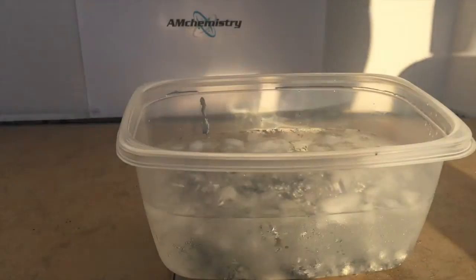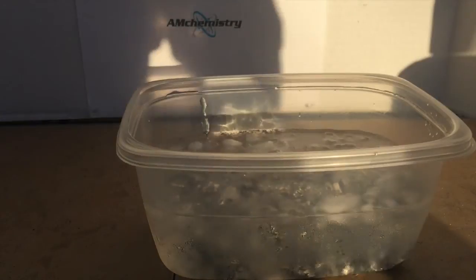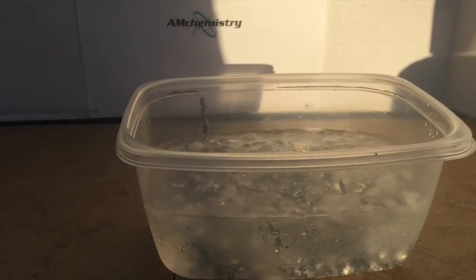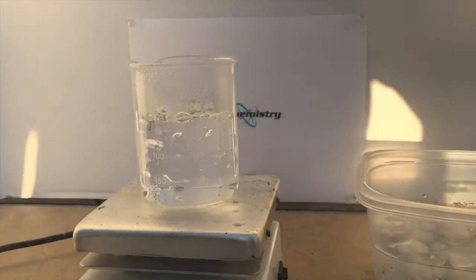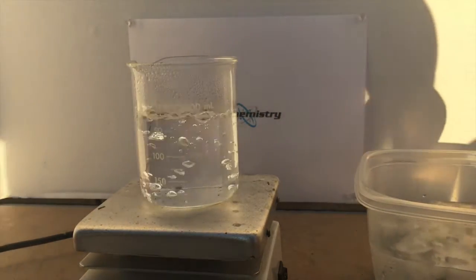And there we have it, we have Wood's metal alloy. Now to put it to the test, let's get some boiling water. Once the water is boiling, let's put the Wood's metal alloy to the test. Let me just grab a piece.